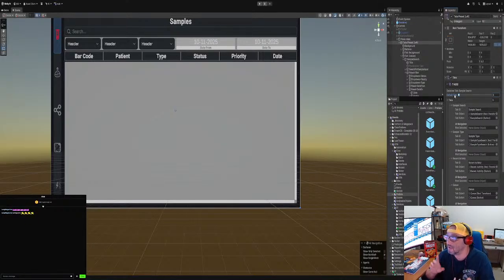That's for another scene. The reason is that each scene would hog a lot of memory or slow it way down. It's just a lot more efficient if you break things up into parts and then break it across a bunch of scenes. So there's going to be a test scene that's going to have everything to do with tests. Then you're going to have an inventory scene that's going to do everything to do with inventory, and on and on and on, right?